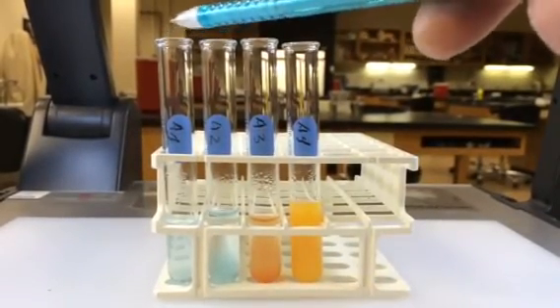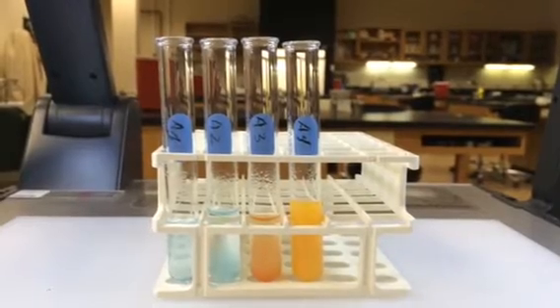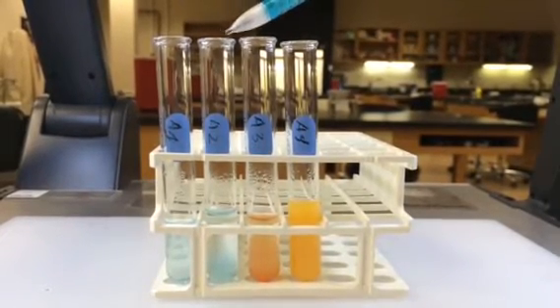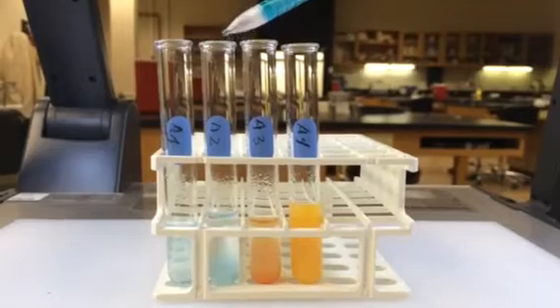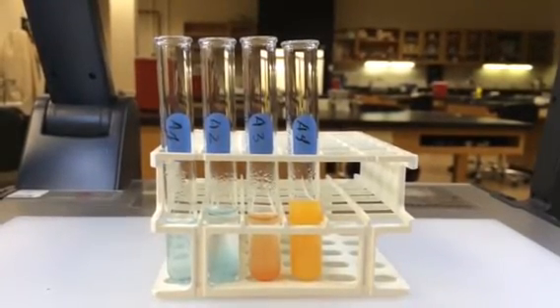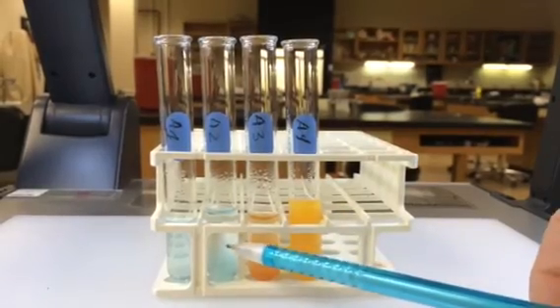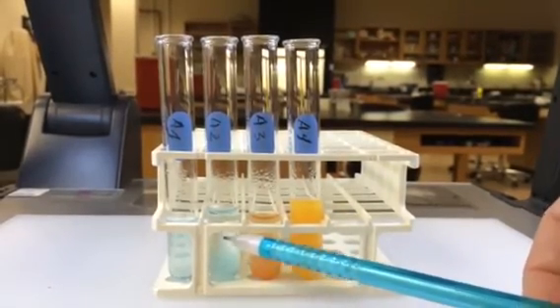A1 is negative, as you would expect. A2 contains starch, water, and Benedict's reagent. You wouldn't expect that to turn green or orange because there's no maltose in that tube, so that's a negative result.